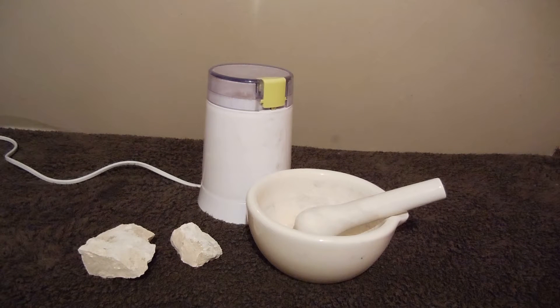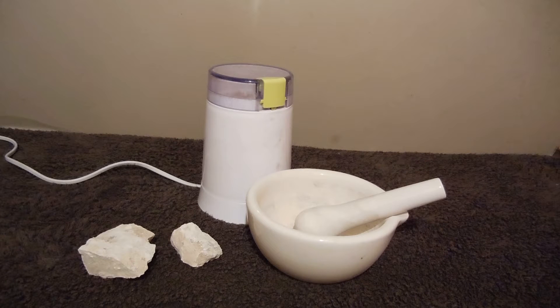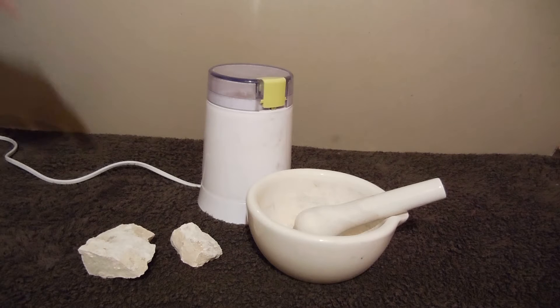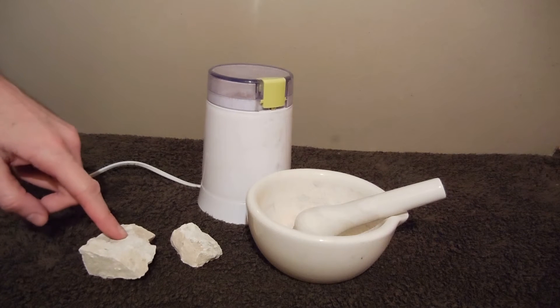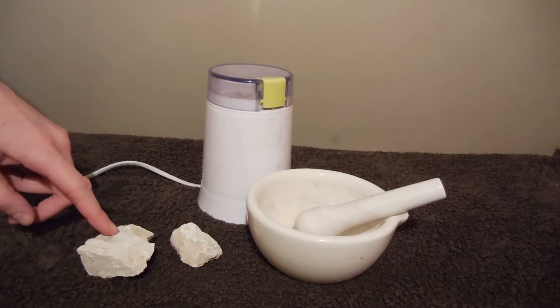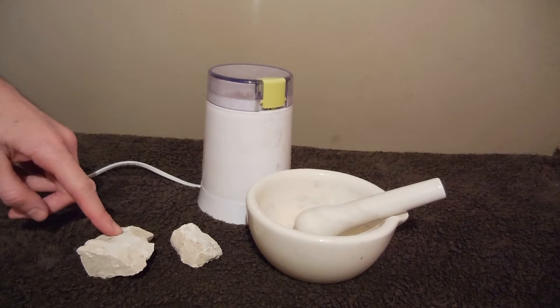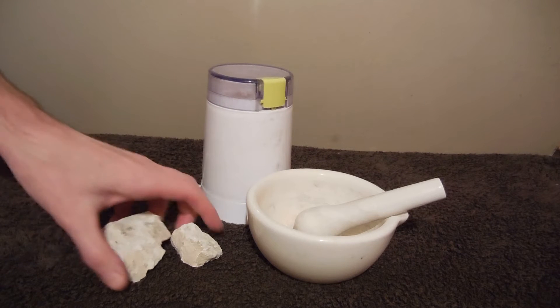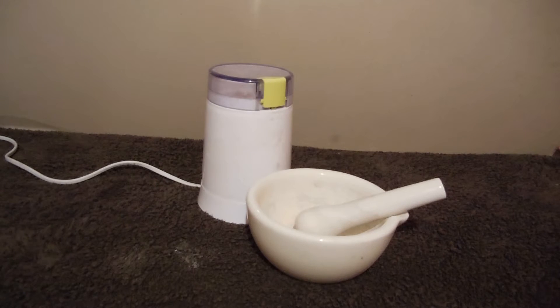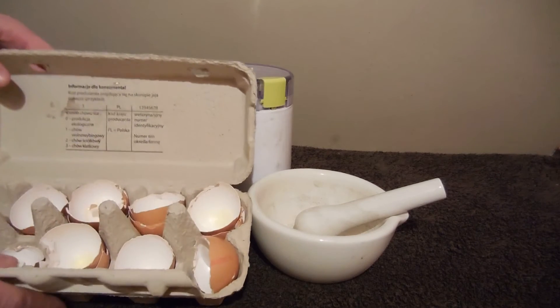Hello! In this video I will show you how to make calcium carbonate. This compound is present in many rocks because they are remnants of prehistoric sea-living animals with shells, living hundreds of millions of years ago. But it is available for free in quite pure form in the thing that we normally throw away to the trash can — eggshells.